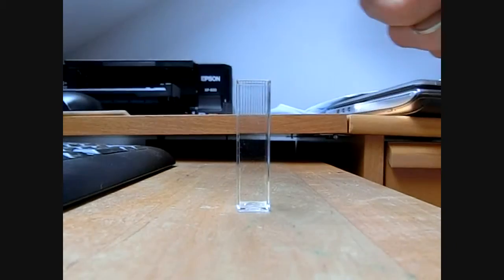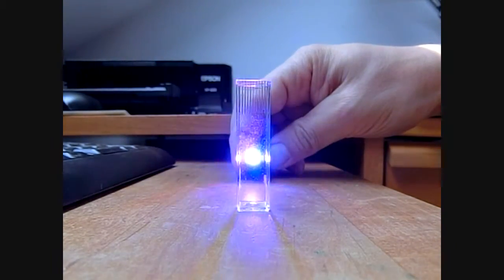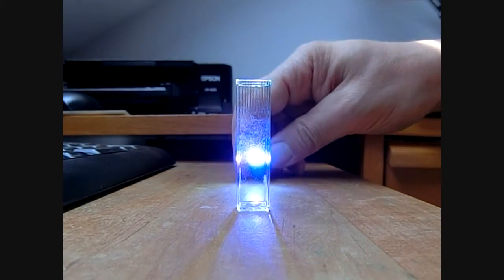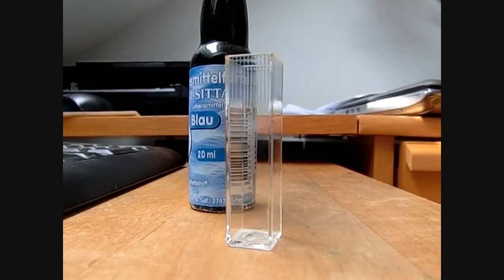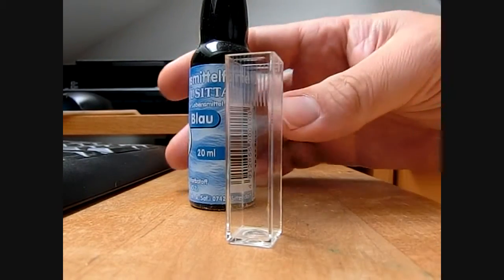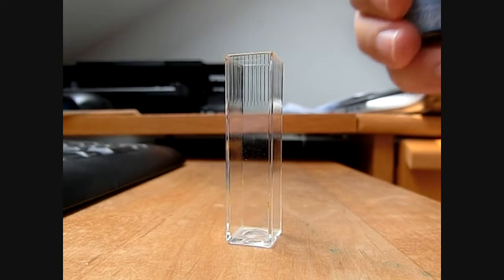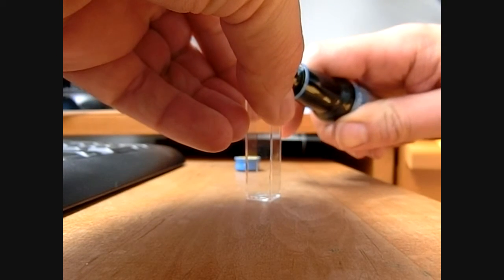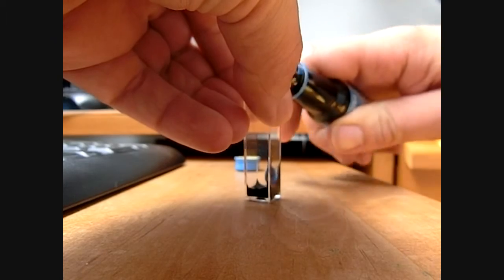For most applications you can also use a light source which is able to emit light of different colors, such as this blinking LED. Now you put a solution you want to measure the concentration of into your cuvette, and for the starting point this is really concentrated.